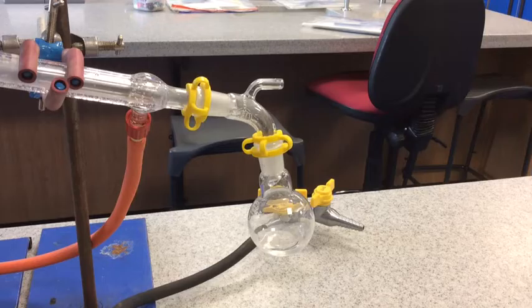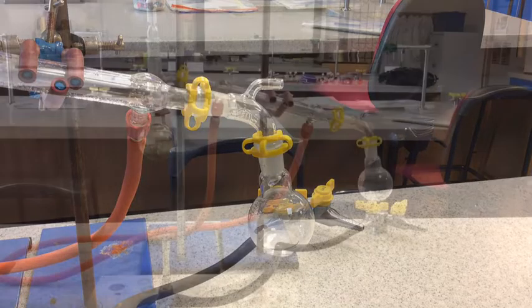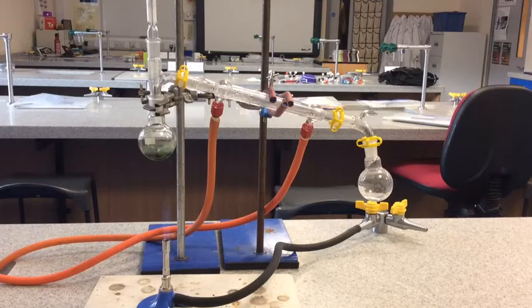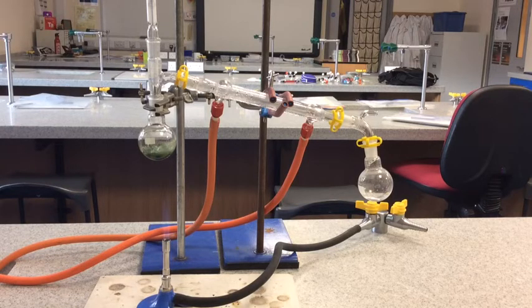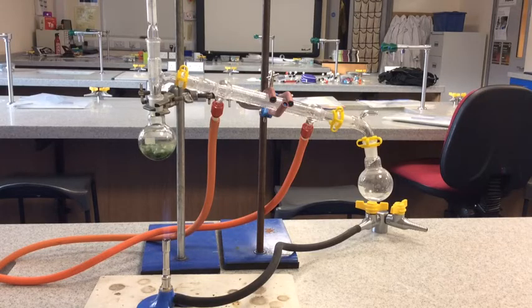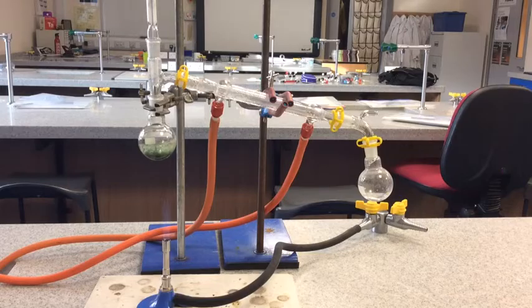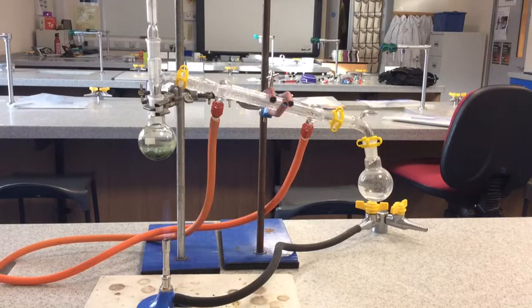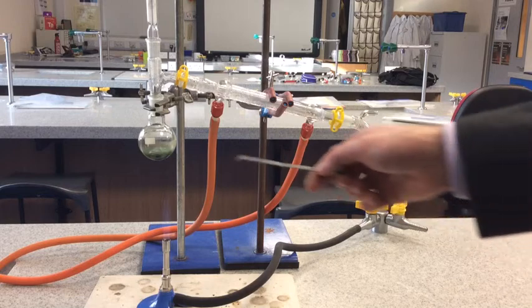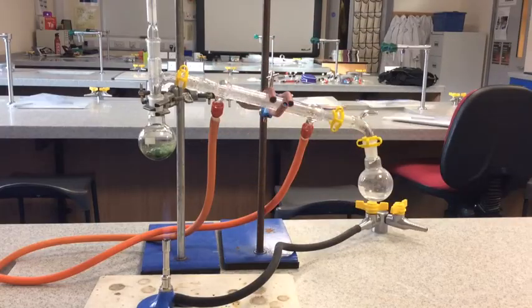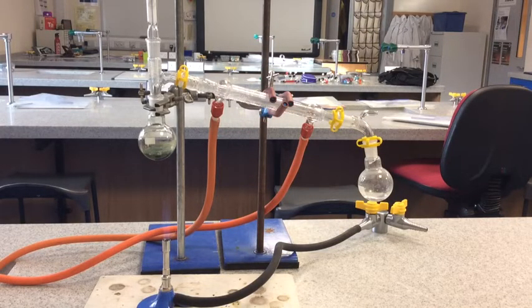Very excited when this drop comes out. There it is, excellent. Now with secondary alcohols it doesn't really make any difference whether you use reflux or distillation, because there's only one oxidation possible. Both methods would produce the same product - they'd both produce a ketone. The preferred method would be reflux, and that's because reflux makes sure that all of the reactant is converted into the product. Any reactant that evaporates up here in reflux would just drop straight back down and be reintroduced to the oxidizing agent.